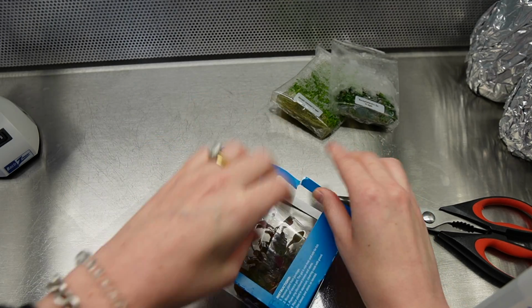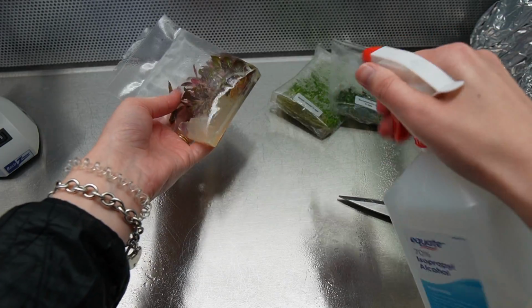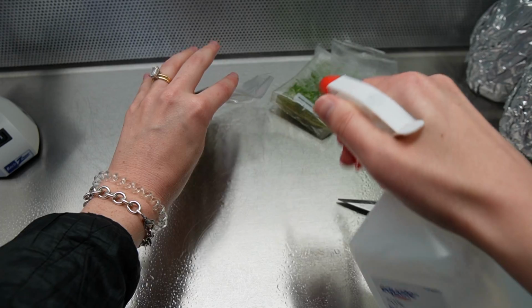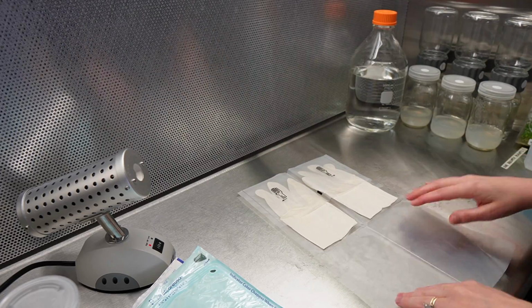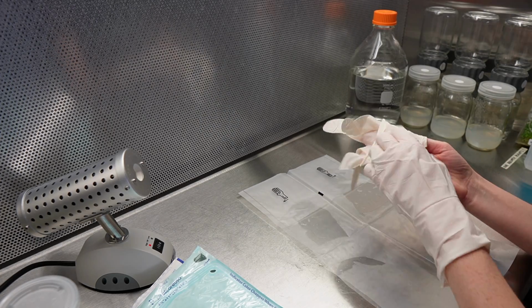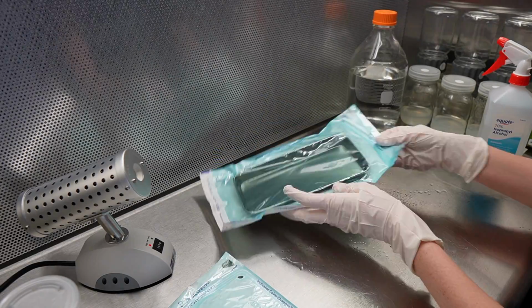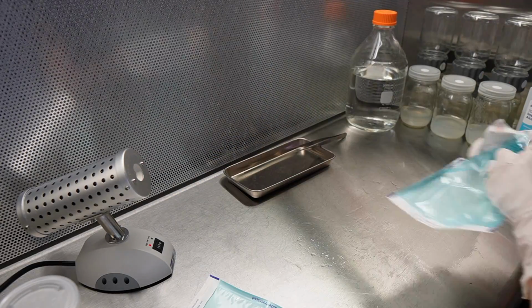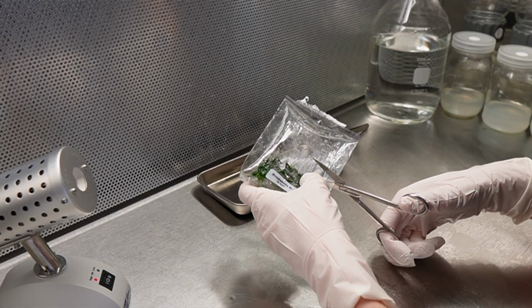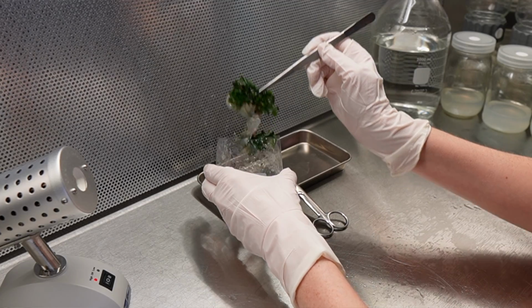I start by spraying the outside of the sealed tissue culture bags with 70% isopropyl alcohol. Because these plants used to live at the pet store, I am very generous with the sauce. After spraying the plants, I leave them to sit and disinfect for about 20 minutes in those sealed tissue culture bags. I'm not going to open the bags until I am ready to handle the plants. All of the tools, including the stainless steel scissors, which I use to cut the bags open, have been autoclaved for 30 minutes prior to beginning this process.